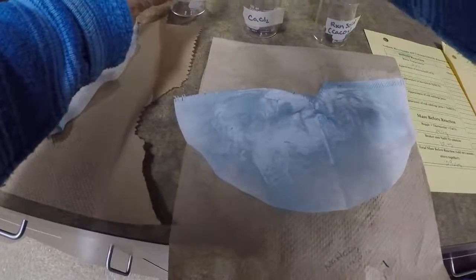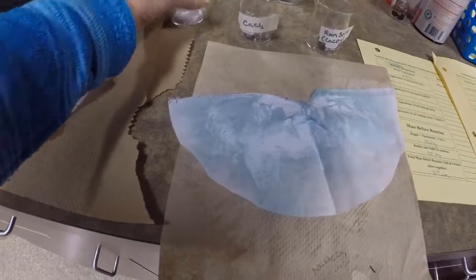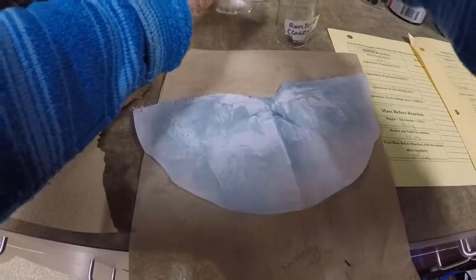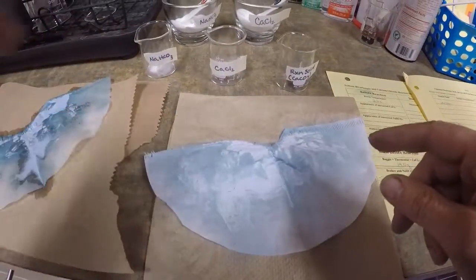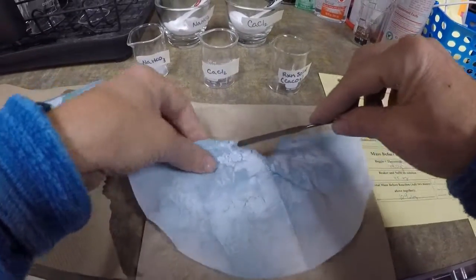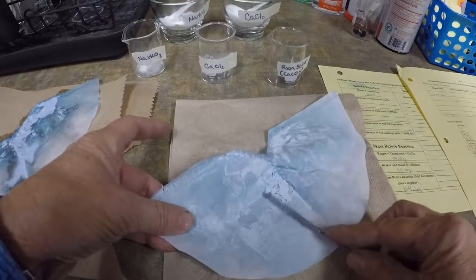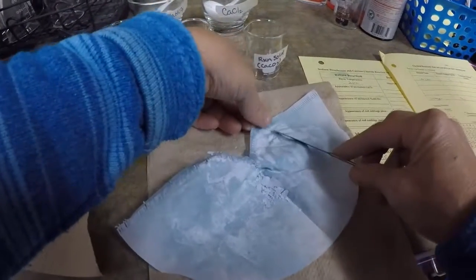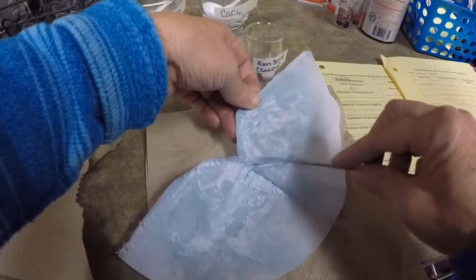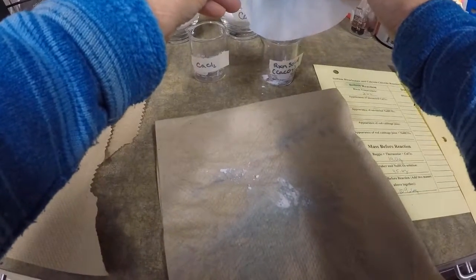We're going to confirm that a chemical reaction actually happened by placing each of my reactants in a beaker, and I need to, let's see if this works, plus what I've created. So I'm just going to flake it off of here, and you want actually a 1/4 teaspoon, but I'm just going to go ahead and dump the whole thing because that's kind of close to a 1/4 teaspoon. I'm going to put it all in there.